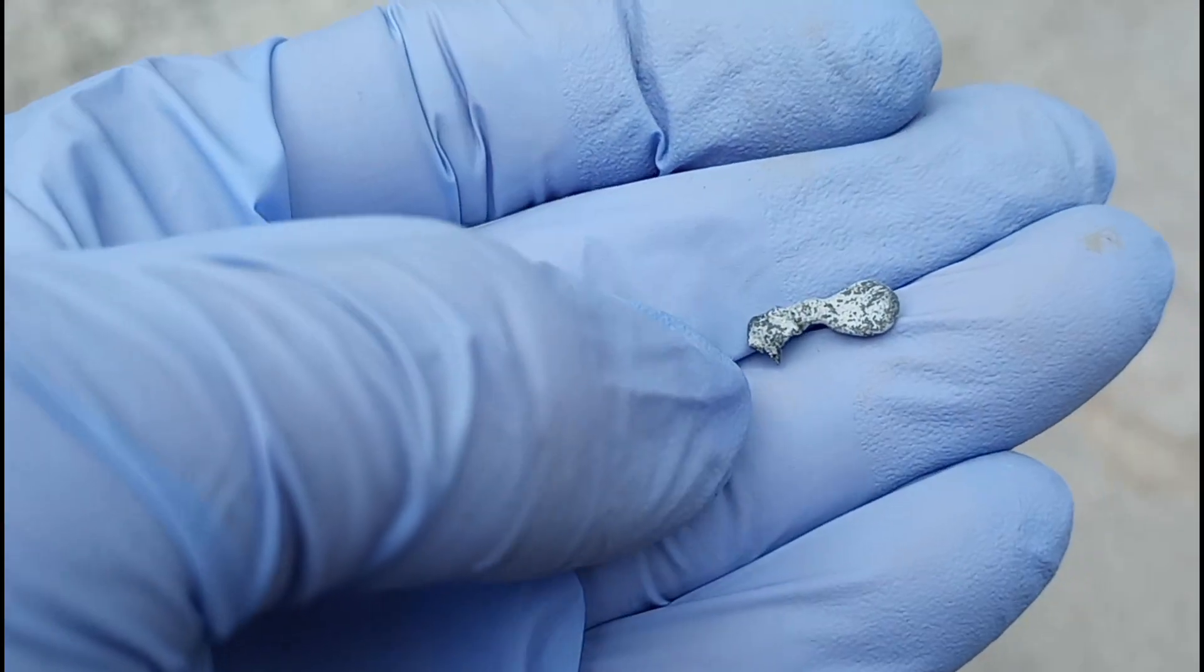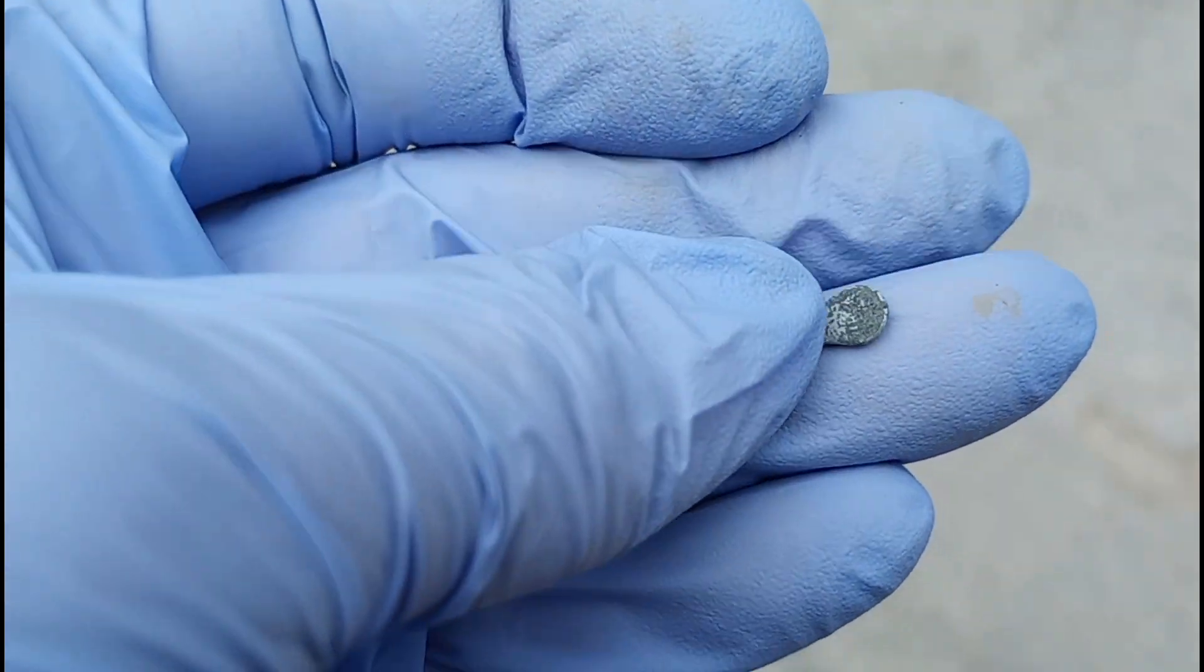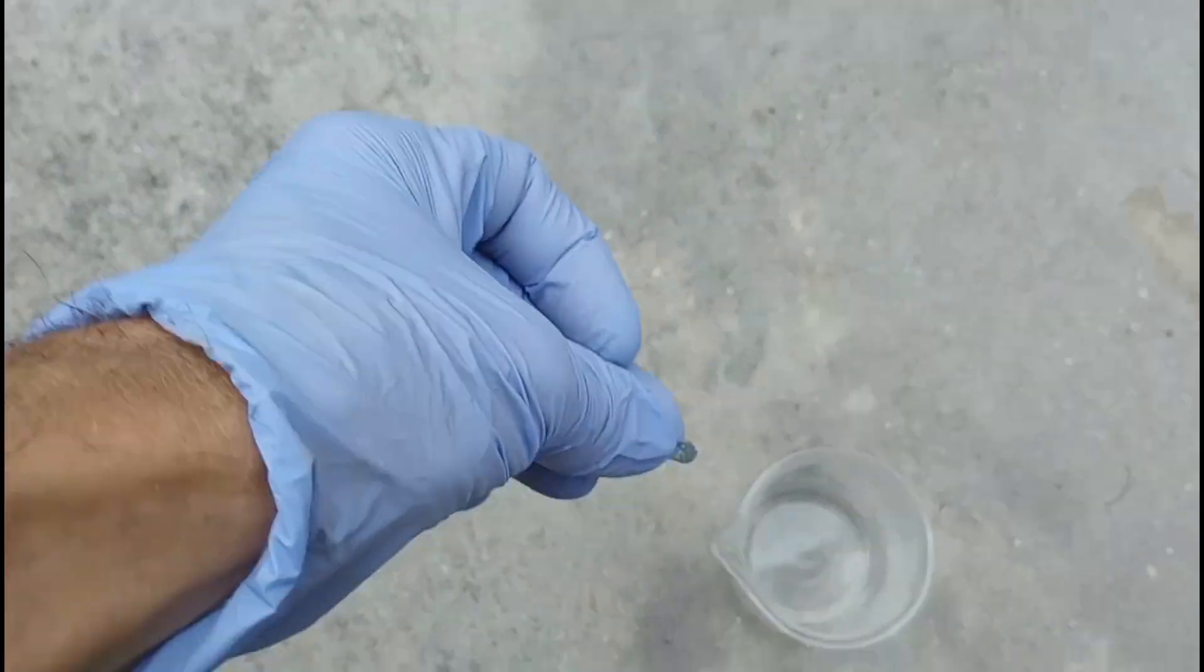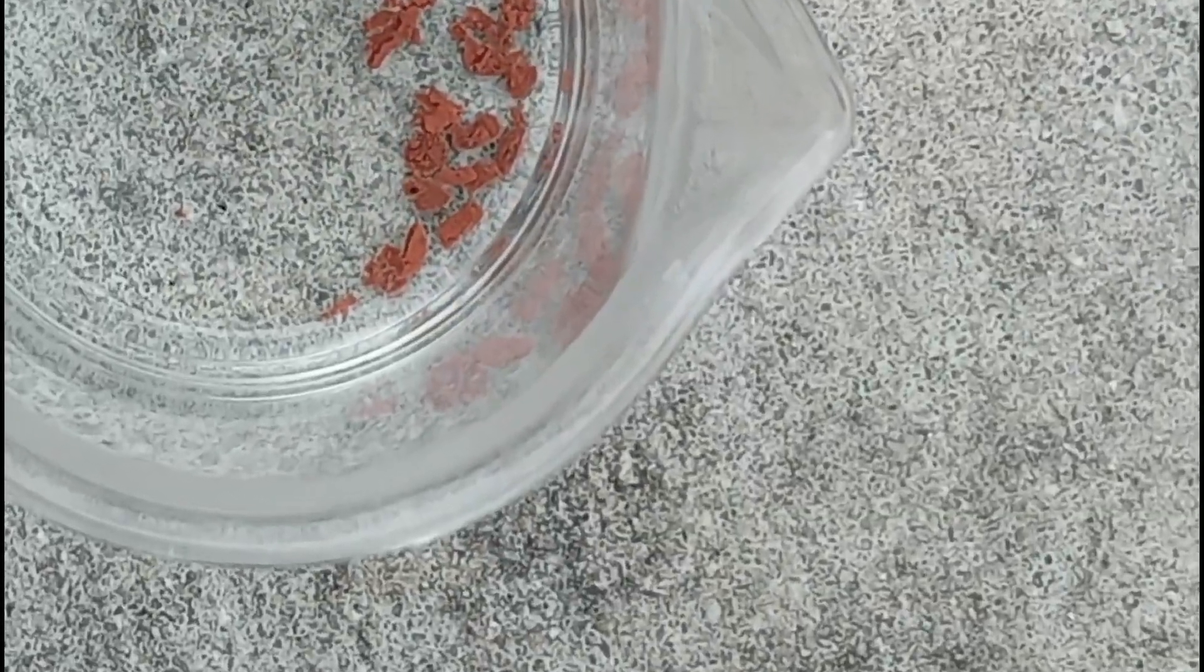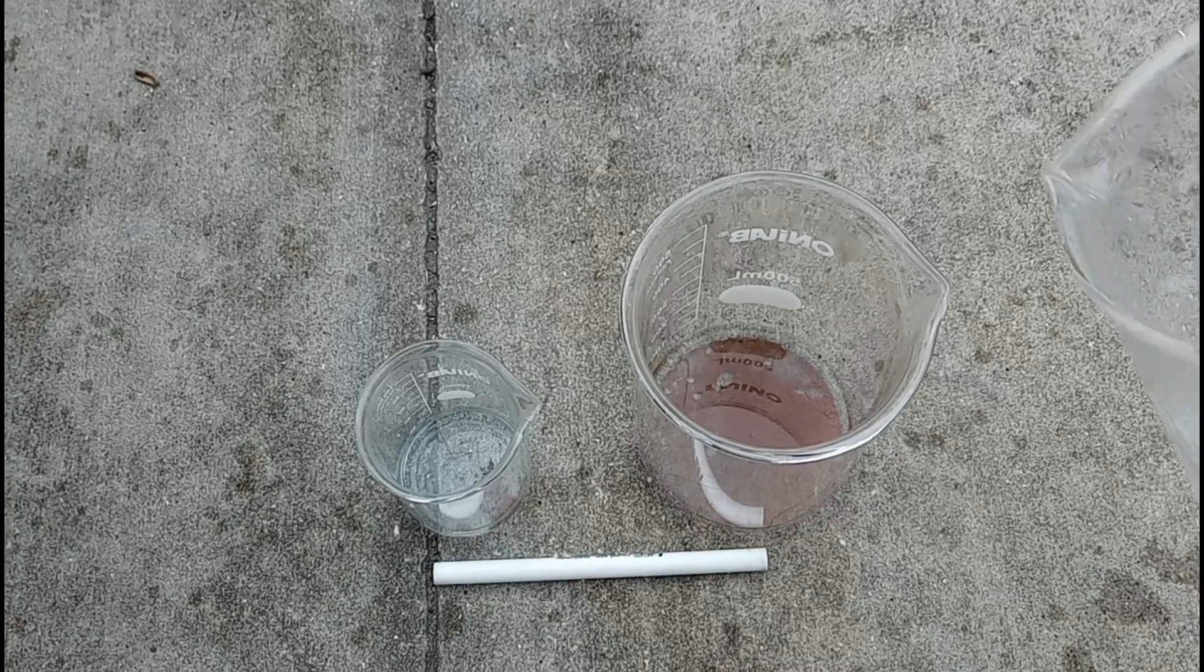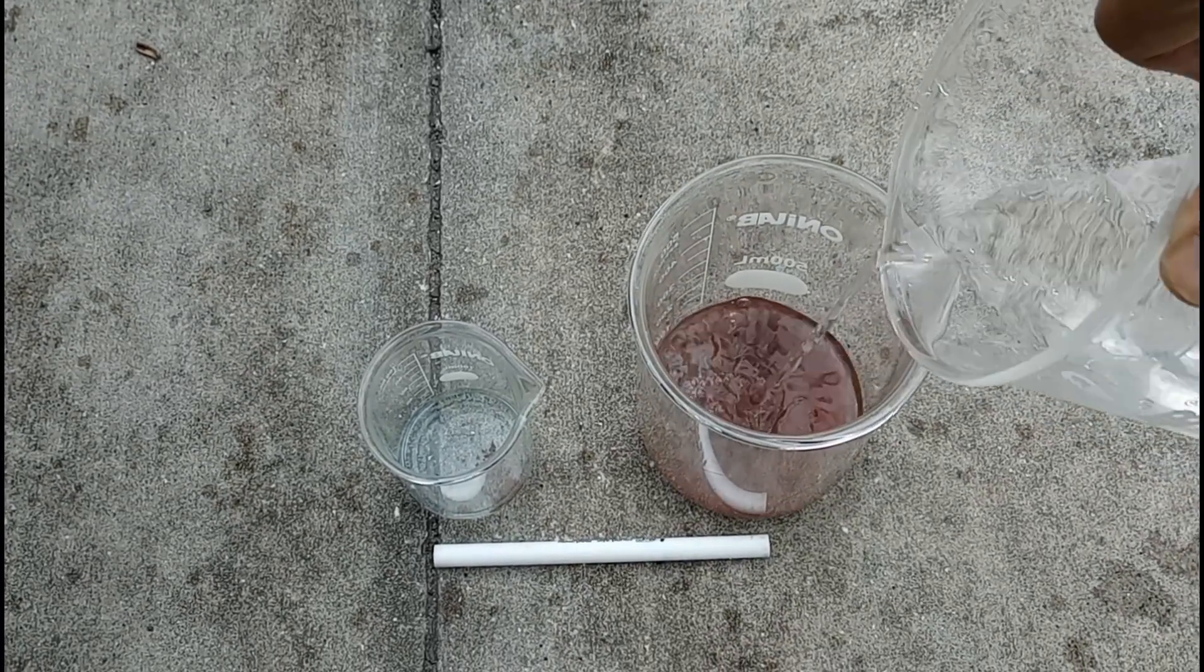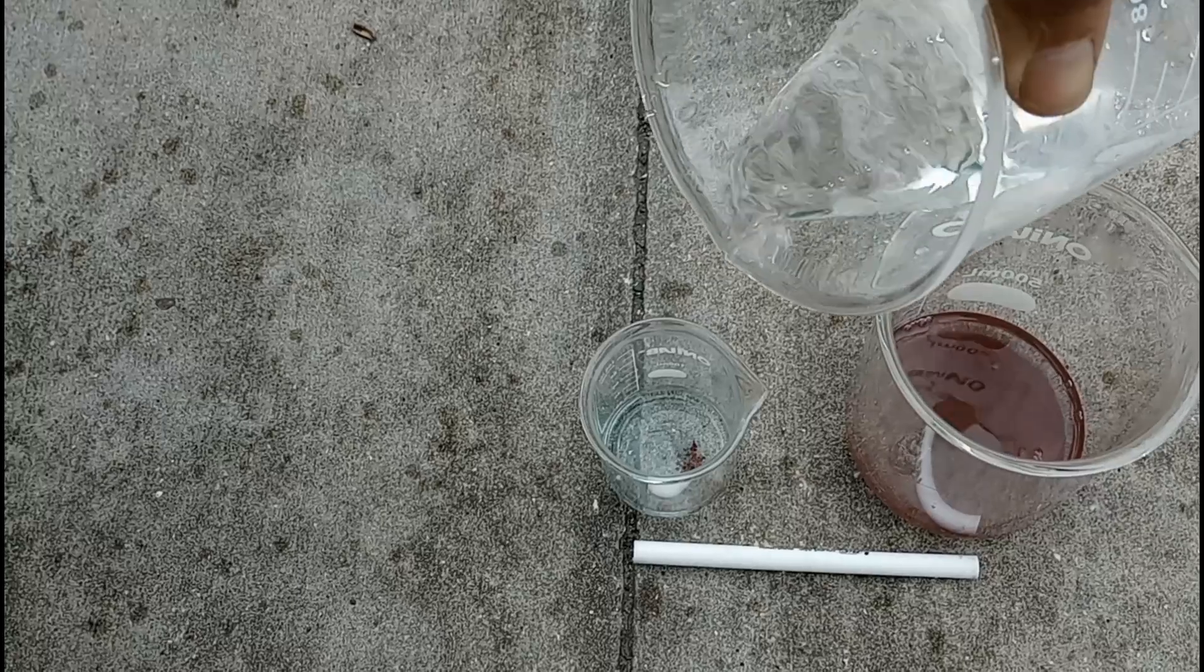This is a small piece of zinc that we used to displace the copper in part four of the brass copper zinc and acid series. I put it in the same beaker that we dissolved the aluminum in, and almost instantly, there was a reaction. Then something unexpected happened. When the zinc dissolved, it left behind what looked like a copper residue. I can only assume that the zinc displaced more of the copper than was originally apparent.